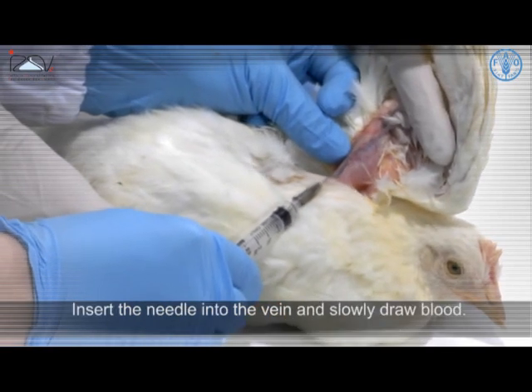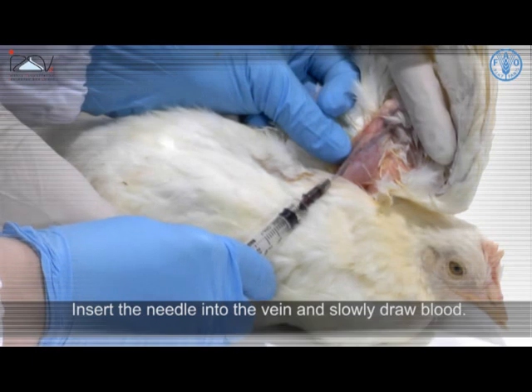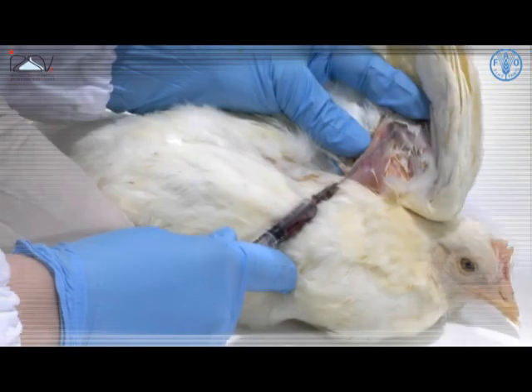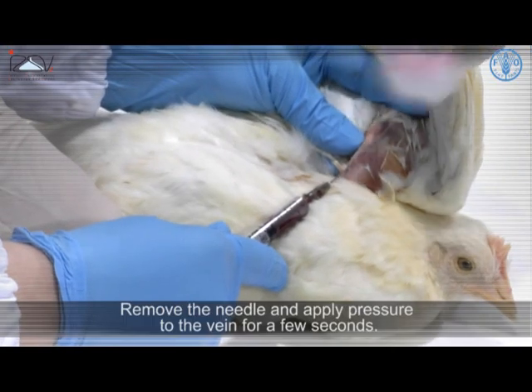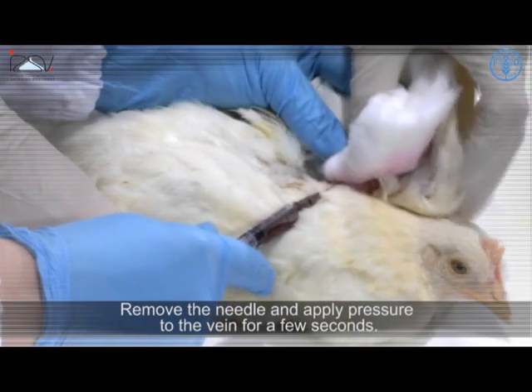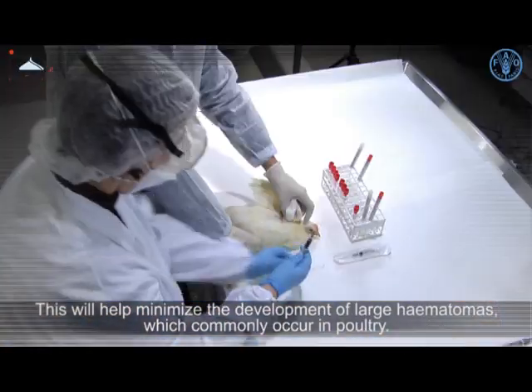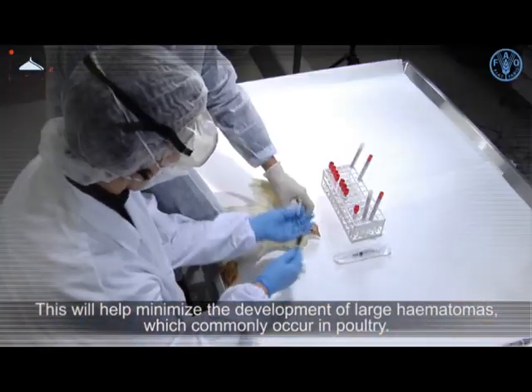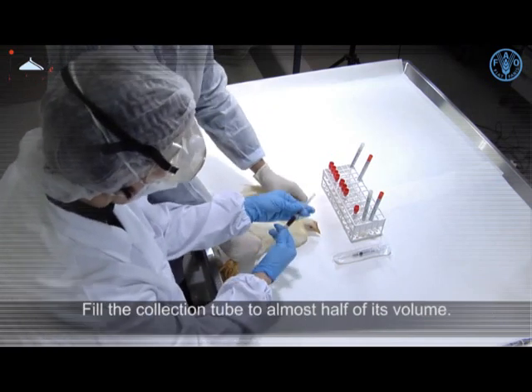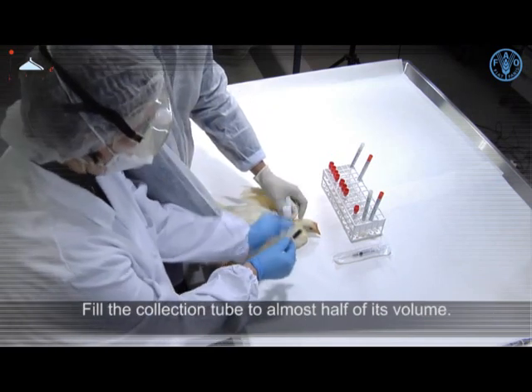Insert the needle into the vein and slowly draw blood. Remove the needle and apply pressure to the vein for a few seconds. This will help minimise development of large haematomas, which commonly occur in poultry. Fill the collection tube to almost half of its volume.